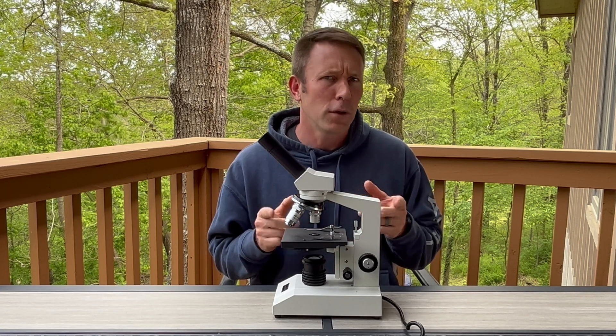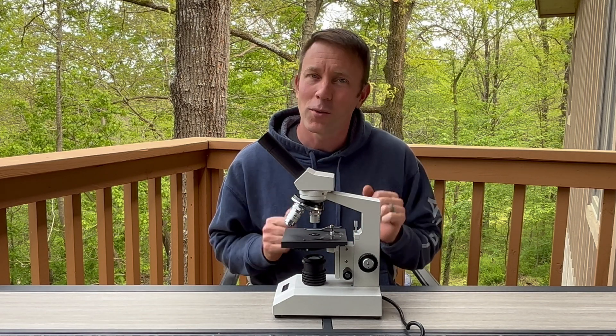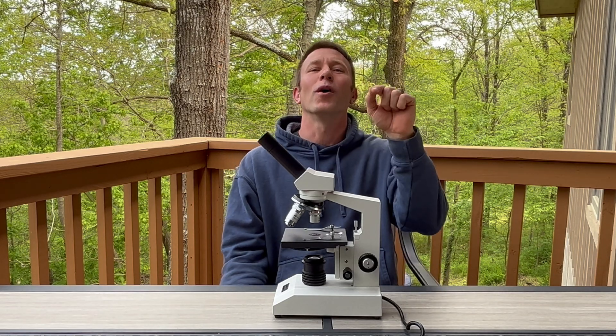Everyone loves using a microscope — you get to see things that are invisible to the unaided human eye. But if you don't know what you're doing, these tools can be a little frustrating. You may wind up just seeing a blur or nothing at all. Don't worry — give me a few minutes and I'm going to make you a pro at using the microscope.